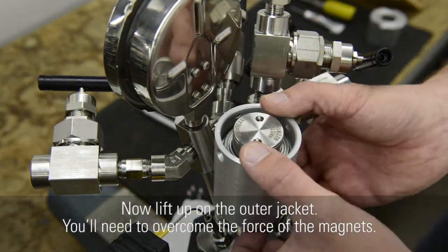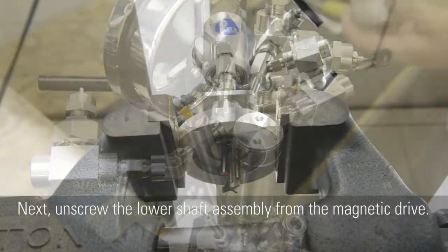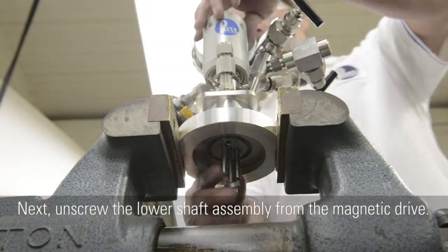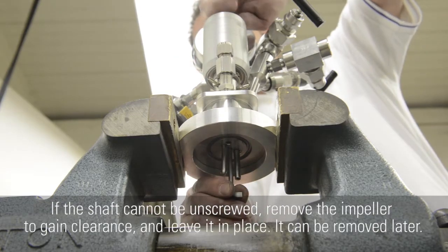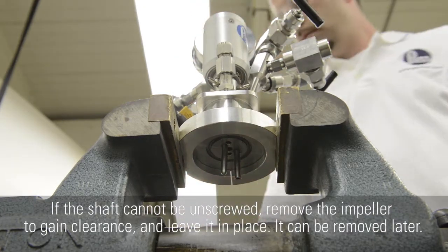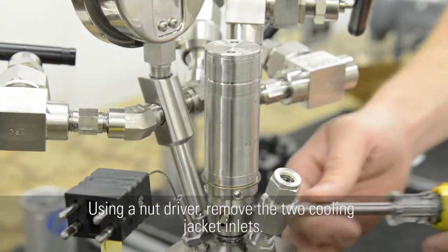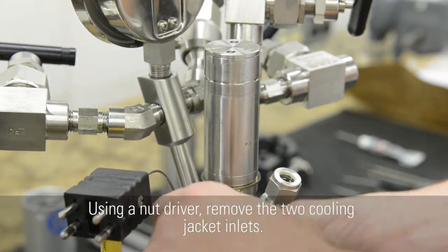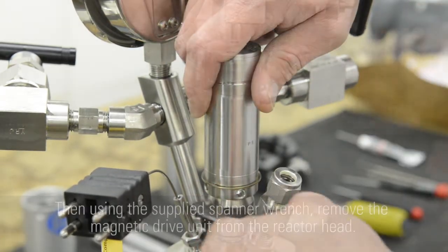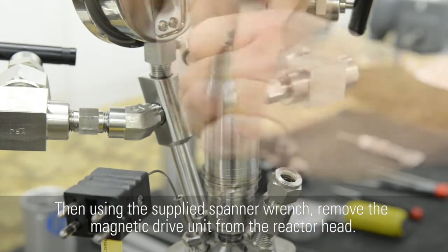Now lift up on the outer jacket. You'll need to overcome the force of the magnets. Next, unscrew the lower shaft assembly from the magnetic drive. If the shaft cannot be unscrewed, remove the impeller to gain clearance and leave it in place. It can be removed later. Using a nut driver, remove the 2 cooling jacket inlets. Then, using the supplied spanner wrench, remove the magnetic drive unit from the reactor head.